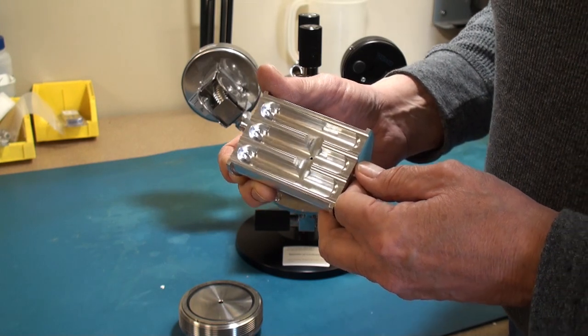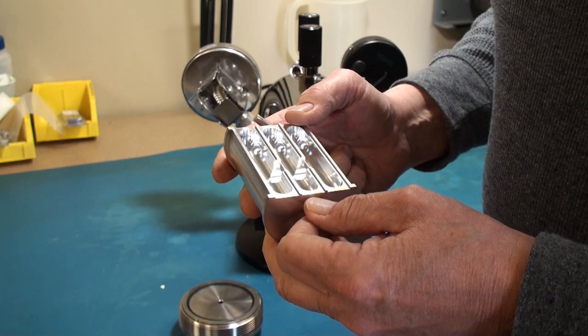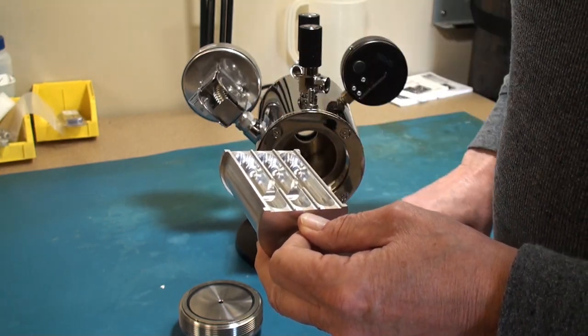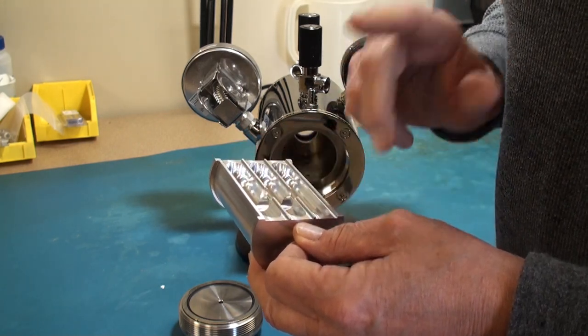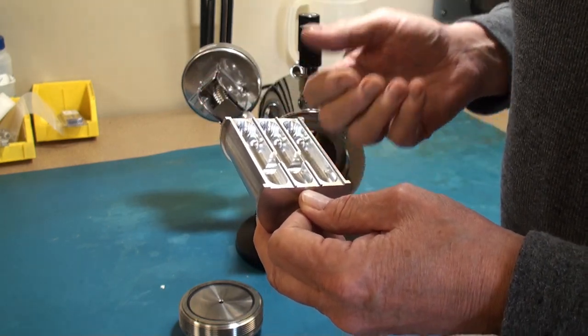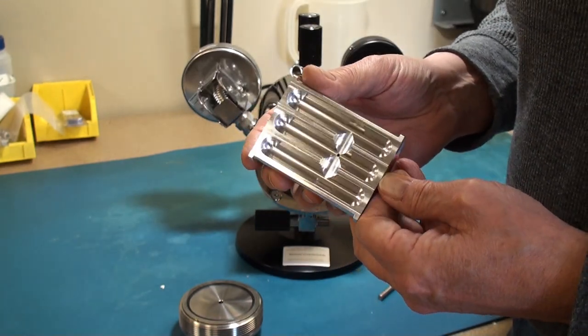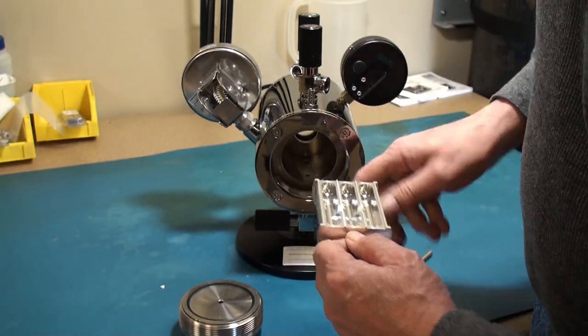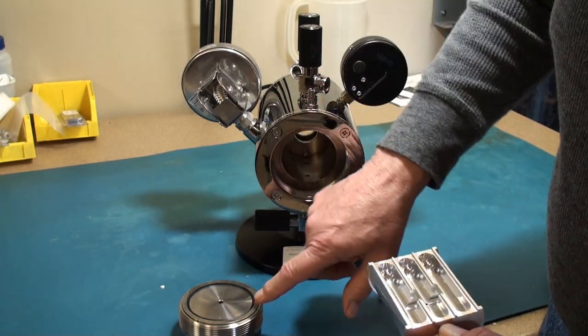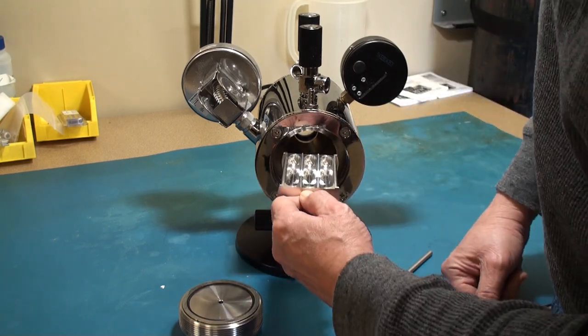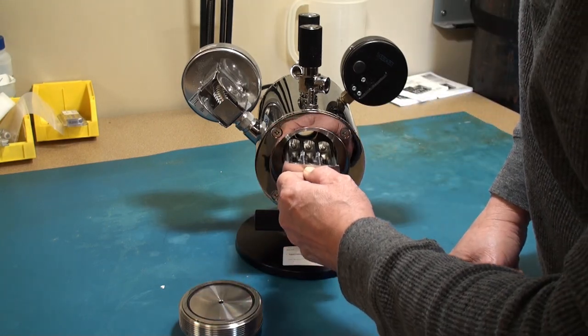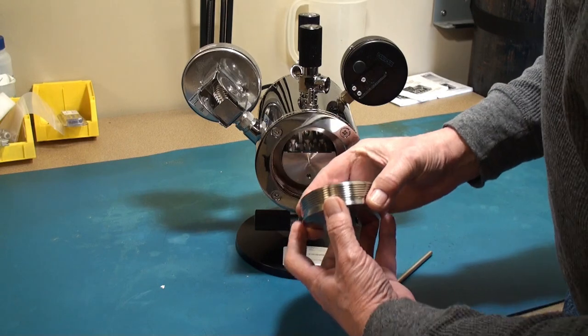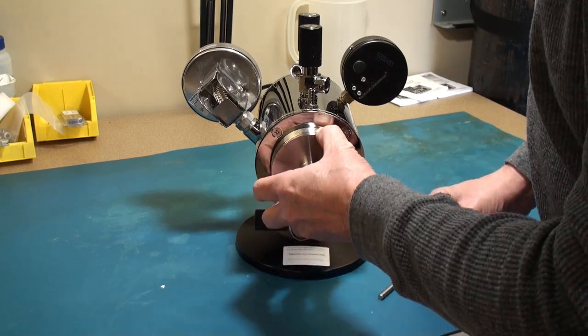As I explained previously, this is the sample holder. You would put your samples in the little baskets and fill the trough to the top so your samples stay underneath the surface of the intermediate fluid because you're trying to prevent air drying. Then you would check and make sure the sealing surface is clean, make sure the o-ring is clean, and you would insert this into the back.